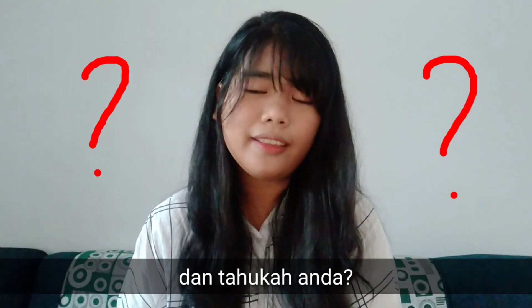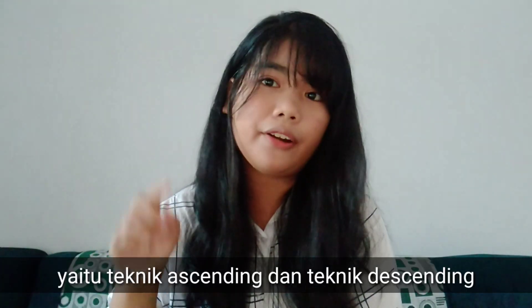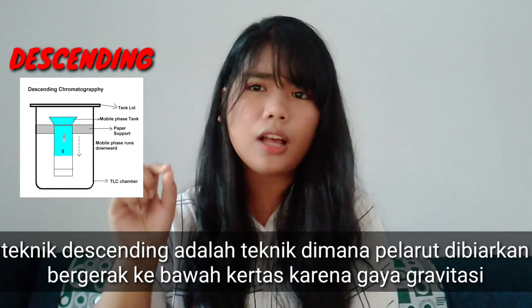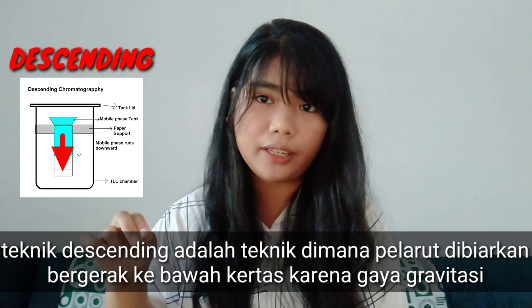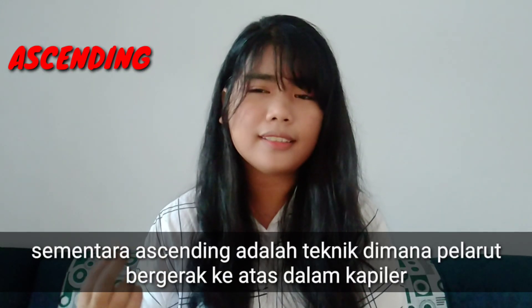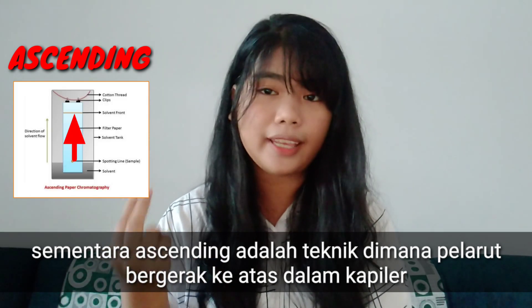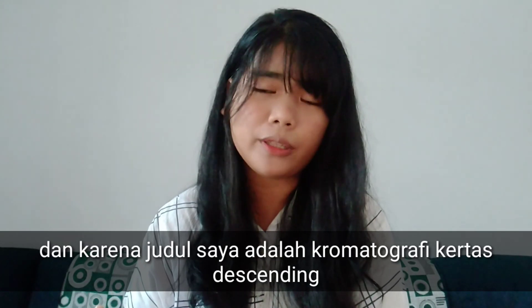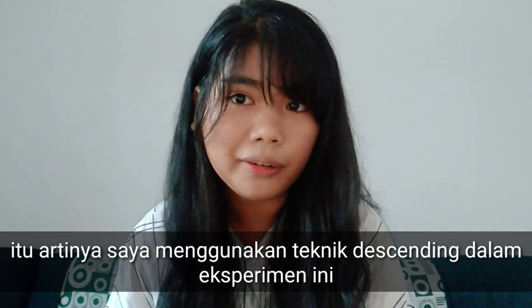There are two main techniques of paper chromatography: ascending and descending. The descending technique is one in which the solvent is allowed to move down the paper due to gravity, while the ascending technique is one in which the solvent moves upward by capillary action. Since my title is 'Descending Paper Chromatography,' I am using the descending technique in this experiment.